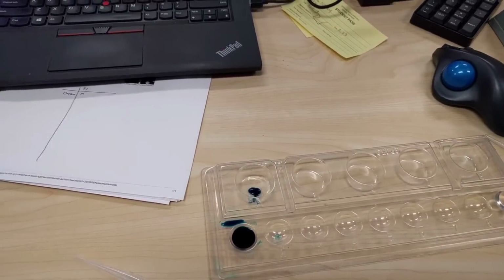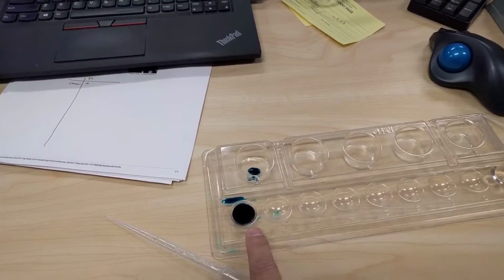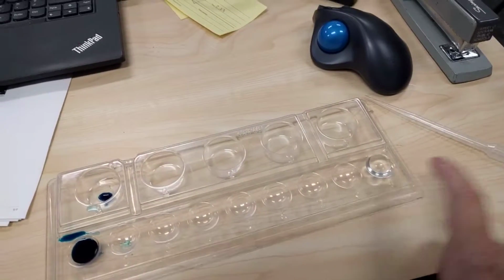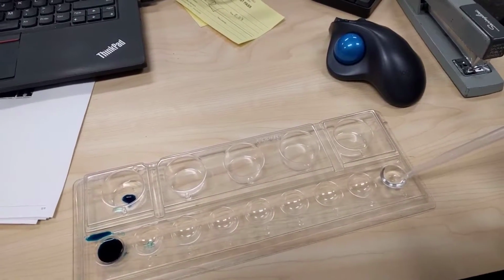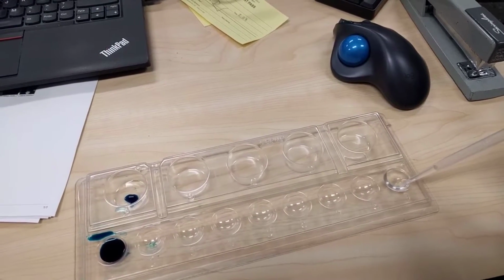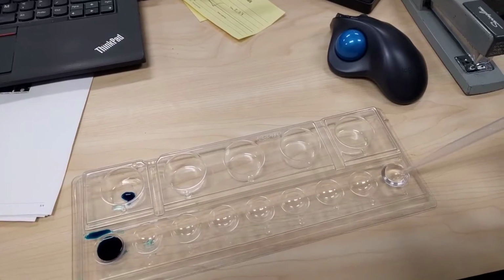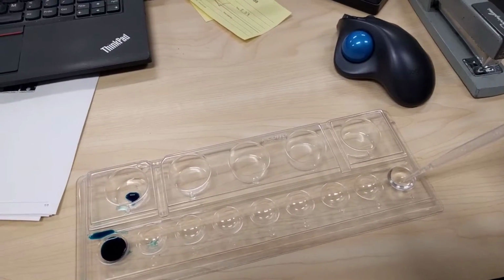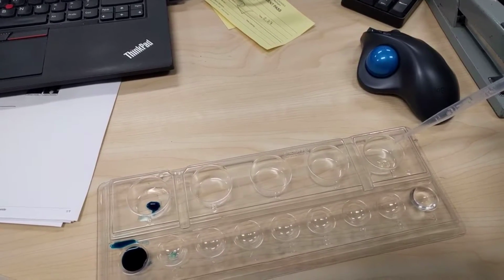okay? Now we do not want to mix the pipettes between our stain and our liquid water. So we have two separate pipettes. So my pipette over here, I use the same way, okay? I just squeeze a tiny bit on the bulb, then I put it in, bring it up, and then I drop it.